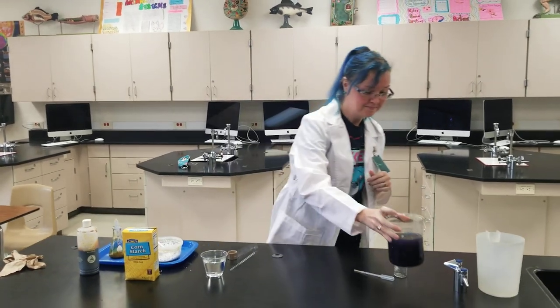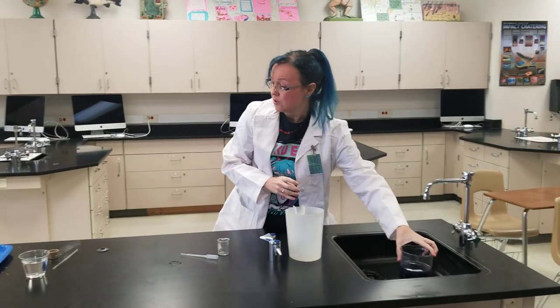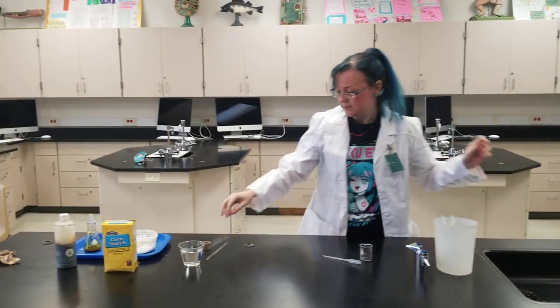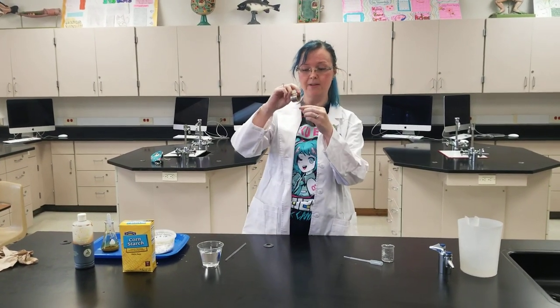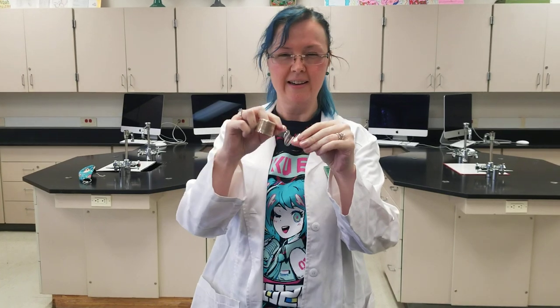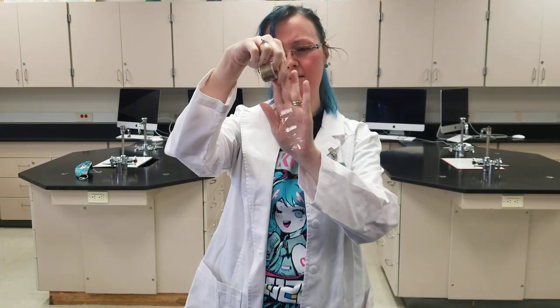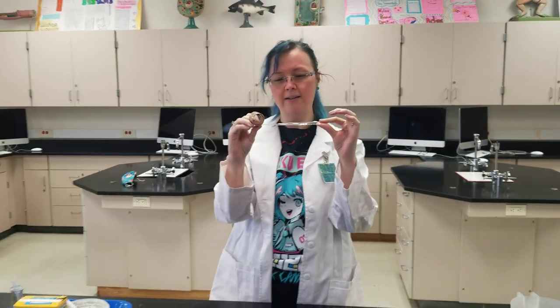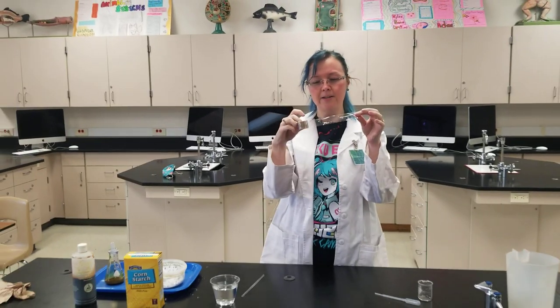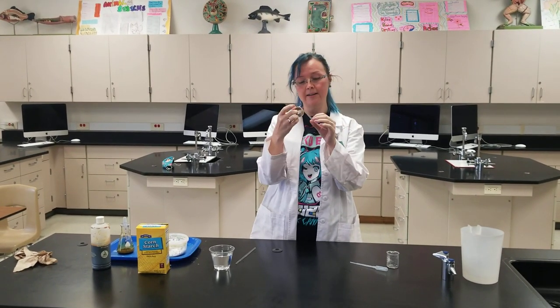Okay, so after you're done, let's go ahead and start our lab. Today we're going to be using something called dialysis tubing. This is what dialysis tubing looks like when it's dry — it kind of looks like tape, it's really hard to see.